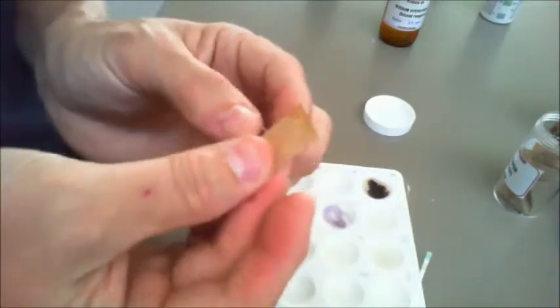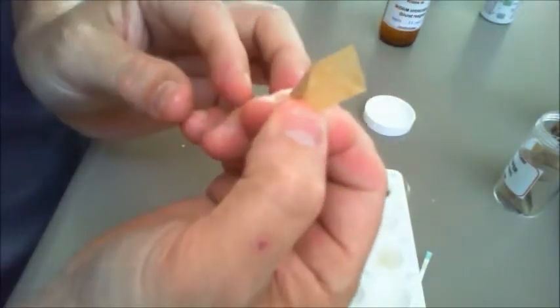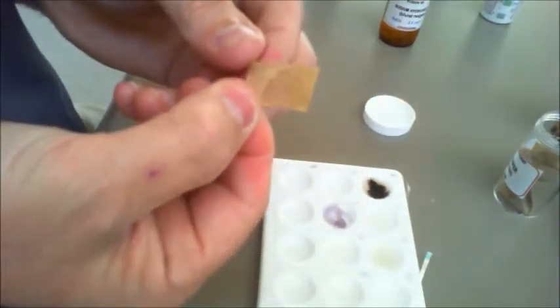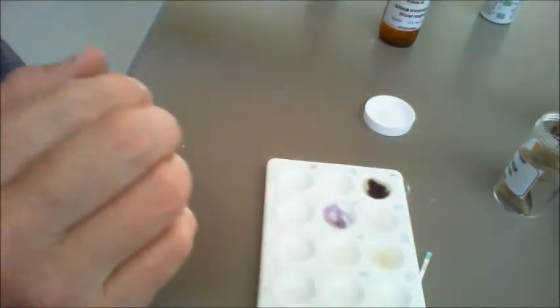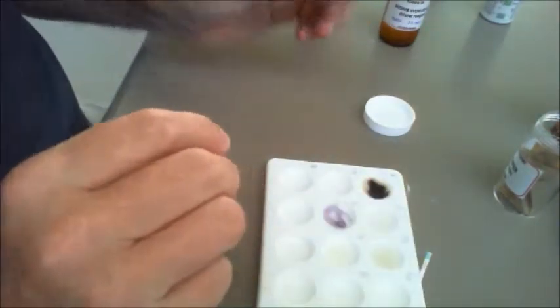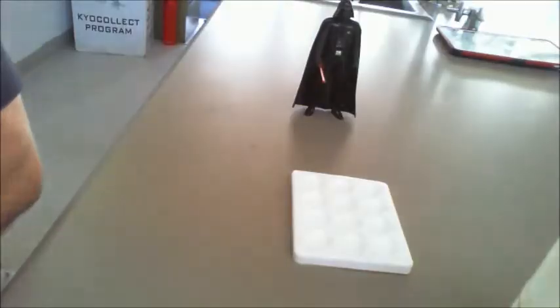We tend to give it a little bit of a rub around as well, and we end up with this mark here, which is translucent. So you can see the slight difference between the two bags there. So if it goes translucent, and you can hold it up to the light, which you can't see there, but you can hold it up to the light and you can see the way through it, and that tells you that there is fat present.